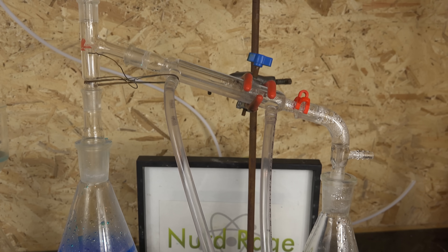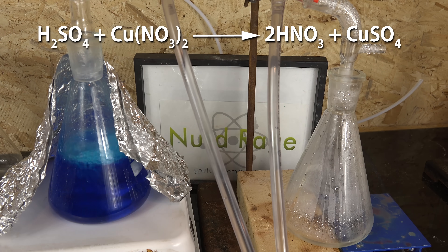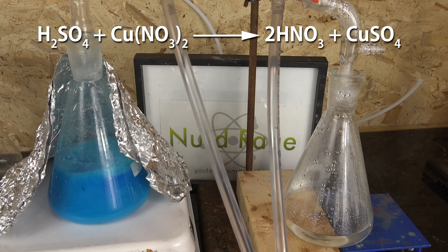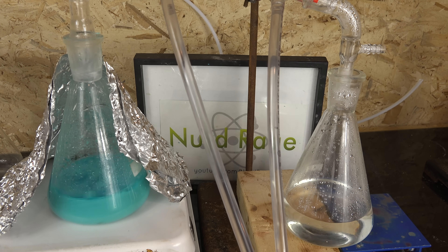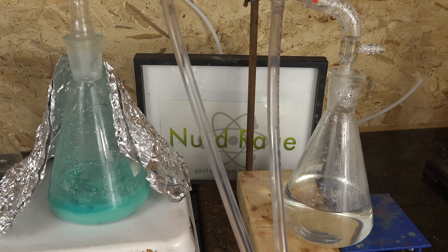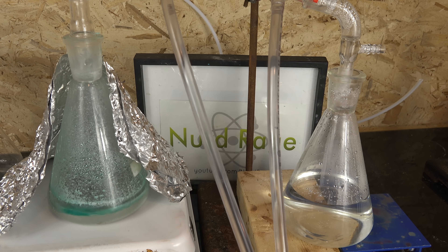At this point we take our copper nitrate solution and set up a distillation apparatus. Then we turn on the heating and distill off the nitric acid. What's happening is the sulfuric acid reacts with the copper nitrate to produce copper sulfate and nitric acid. This process is much more efficient than thermal decomposition of copper nitrate and you can routinely get yields better than 90%. The reason I never presented this as a viable way to make nitric acid is because I honestly thought copper nitrate was far too expensive to buy, and if you could buy it you would also be able to buy cheaper nitrate solids that would be even better. I never realized copper nitrate was a waste product of precious metal refining and thus essentially free.